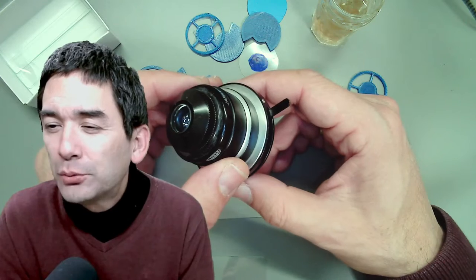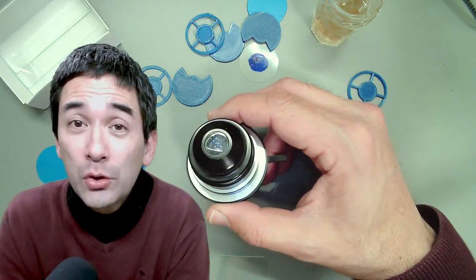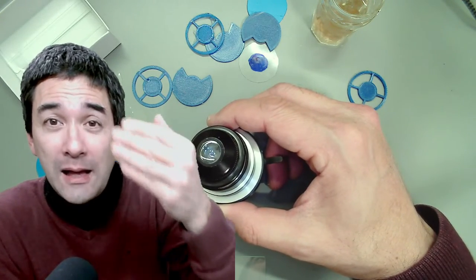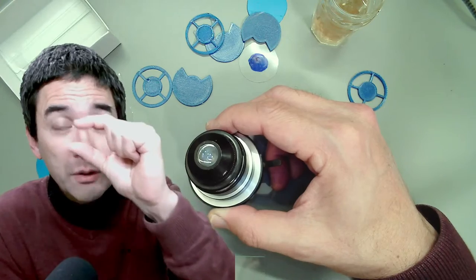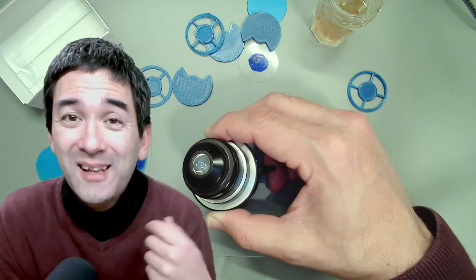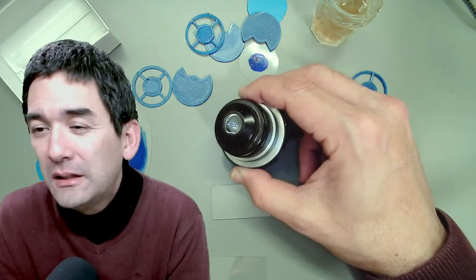Someone has a problem with a blurry 4x objective. Blurry objectives can be because it's dirty — maybe you dipped it in immersion oil. Take it out from the microscope, look at it from behind against a bright wall or lamp to see if there is dirt on the lens. Or it could be that at higher magnifications images can look a little bit blurrier. But most likely if it's really blurry it could be that it's dirty.